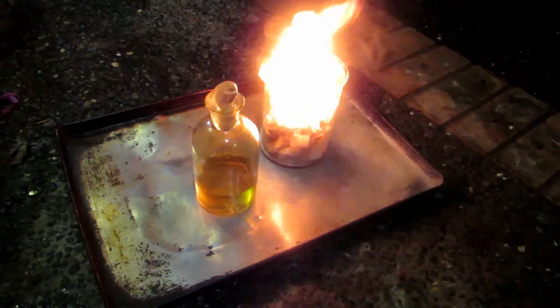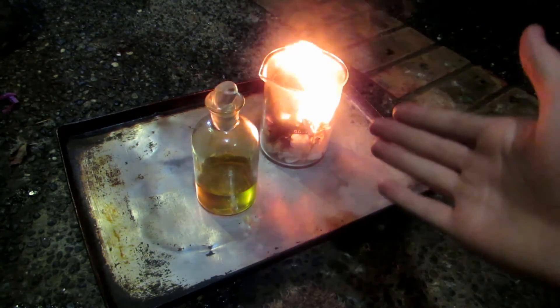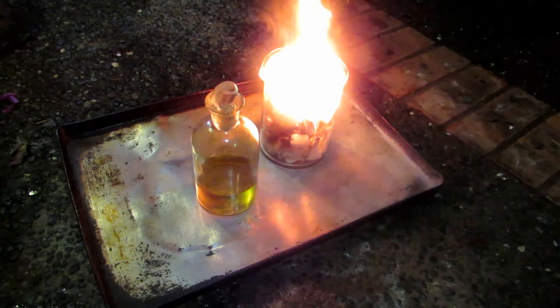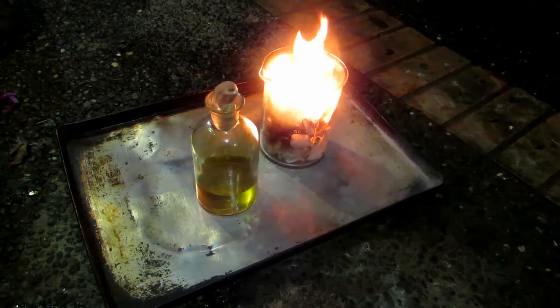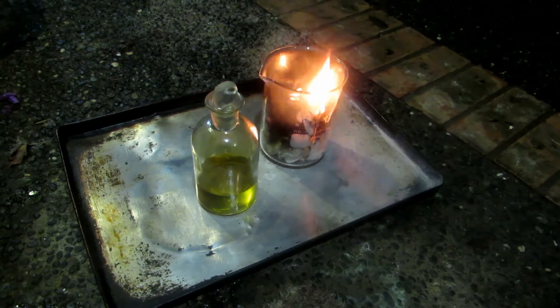So that's why it's extremely important that you never get this stuff on your hands. But even so, with gloves, you'd be far worse off — you'd have burning rubber on your hands. This is just a quick demonstration to show why you never, ever, ever want to wear lab gloves unless they are specifically designed to withstand the highly concentrated acid, and never wear them while you're dealing with highly concentrated acid.